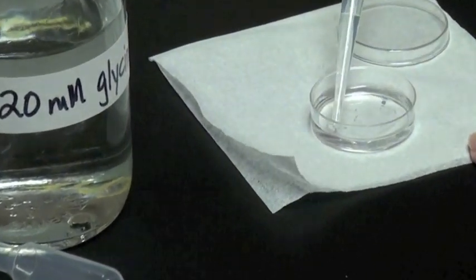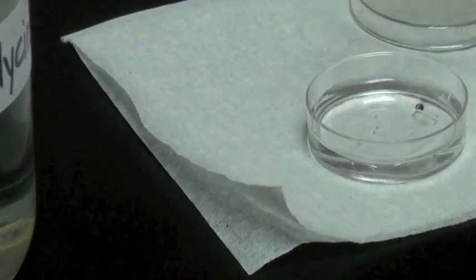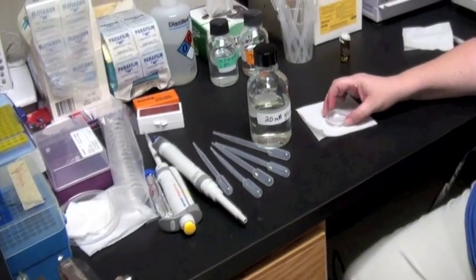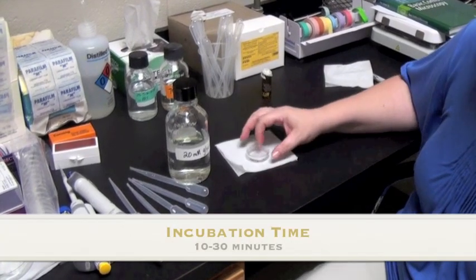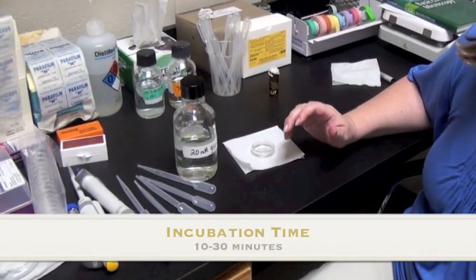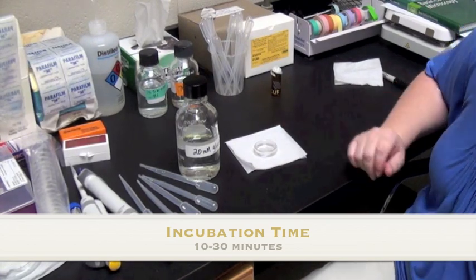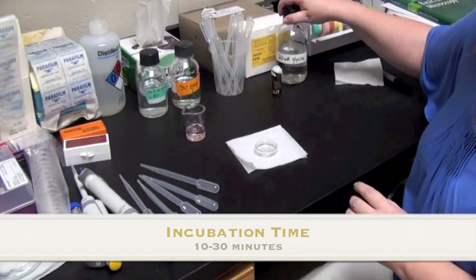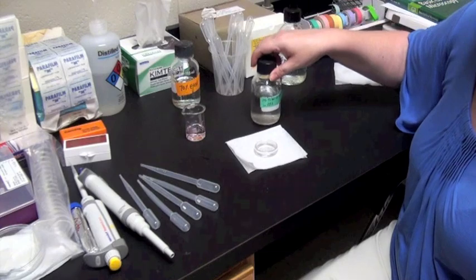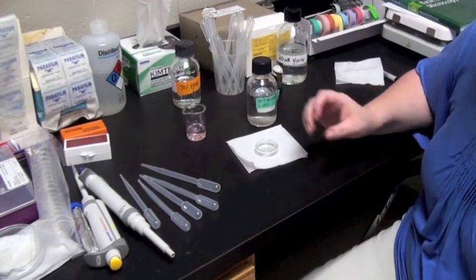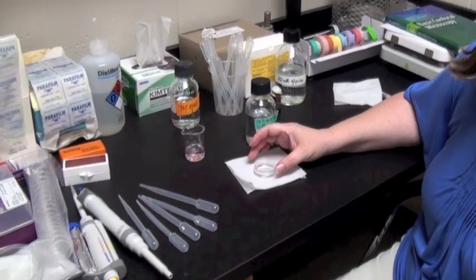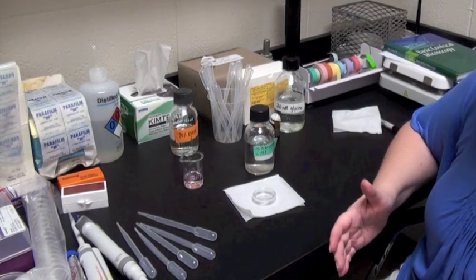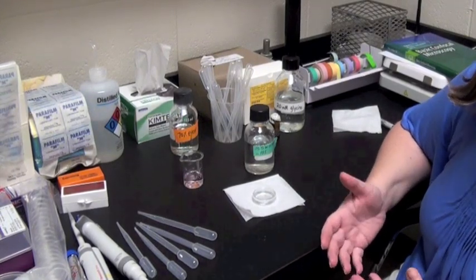I'll incubate this anywhere from 10 to 30 minutes. The exact concentration may vary between 0.1% and 0.5%, and the incubation time again from 10 to 30 minutes. It really depends on what cells you're using or tissue you're using, and you can only determine this unfortunately through a little bit of experimentation. I would suggest starting out with about 0.1% Triton X-100 and a 15 to 20 minute incubation period for the permeabilization step.